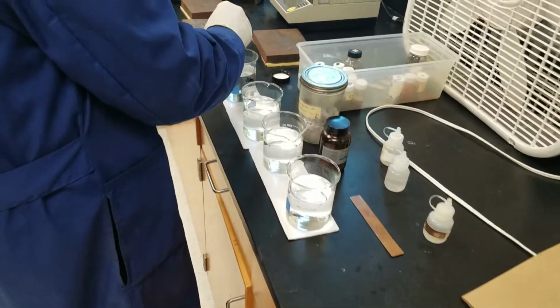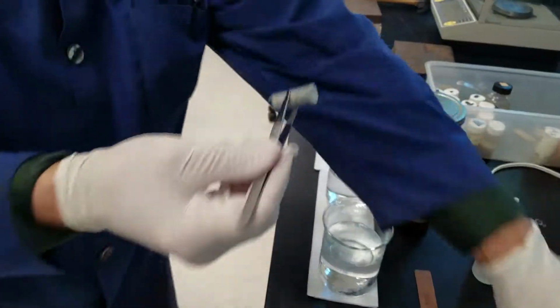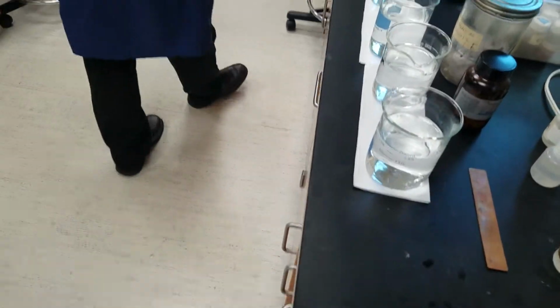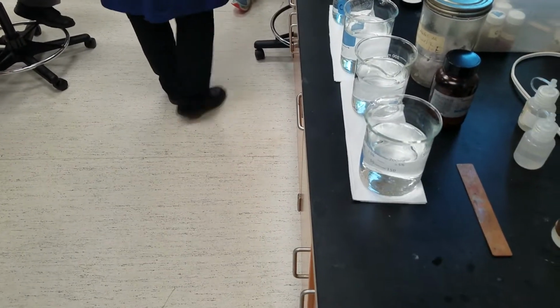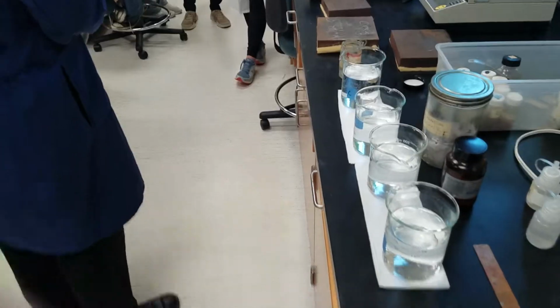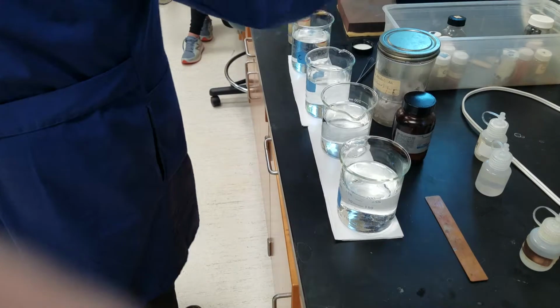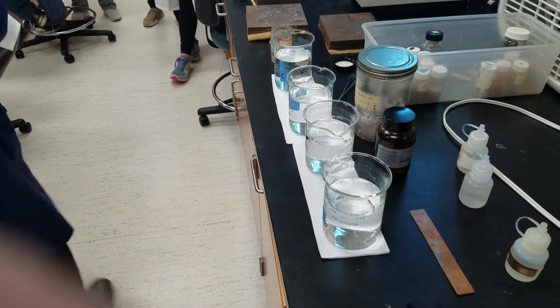So I'm going to dry off this piece, which I want you to hold. There's mineral oil. What do you notice about the mass of that? It's really light. Yeah, real light, in which you have your lithium batteries, lithium-ion batteries. One big advantage is that you have less mass per mole of electrons. So did you get that?